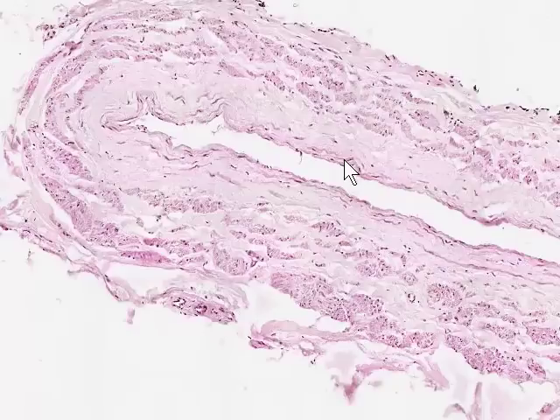The tunica intima, it's difficult to make out precisely where it begins and ends, and arguably we could say that the tunica intima really only extends this short distance here. Then we have a tunica media, which extends variably from, say, here to here, or on this side from here to here, and the tunica media is proportionally made up mainly of connective tissue. However, it's important to note that there is smooth muscle present. These are bundles of smooth muscle cells, and where the smooth muscle is present, it's cut in cross or oblique section, indicating that these smooth muscle bundles are oriented longitudinally with respect to the long axis of the vessel.